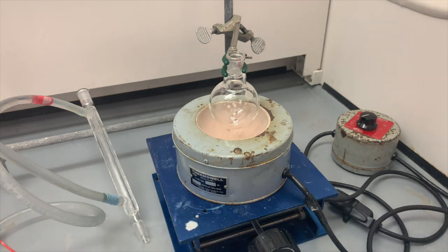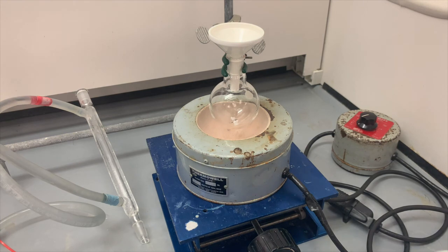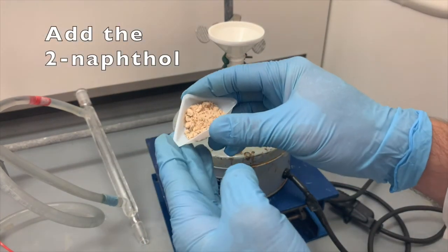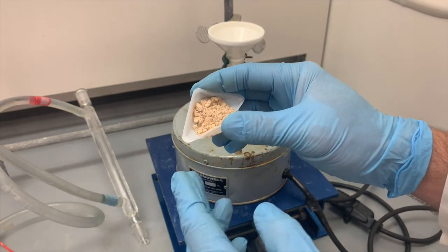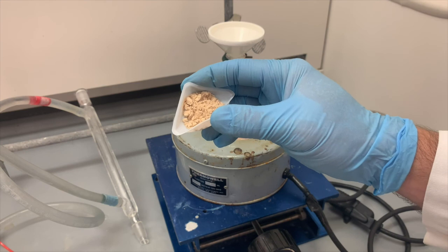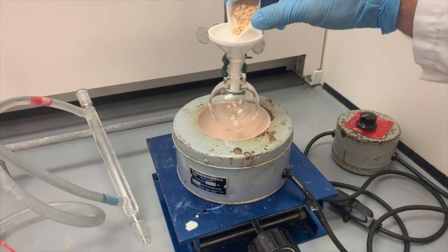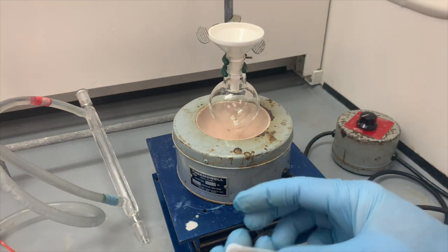Now we can take this funnel, add it to the top, and we're going to add the 2-naphthol. This had a couple large particles that I broke down with a spatula, and hopefully it will all flow down through here. If it gets stuck, I have to break it up with the spatula. See, it's kind of getting stuck.